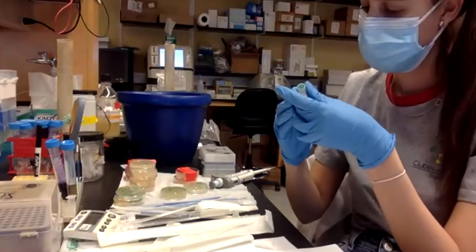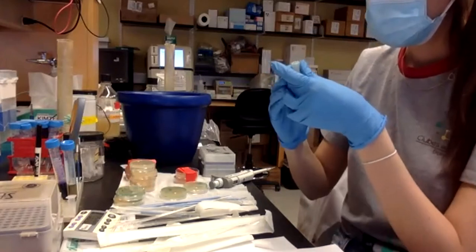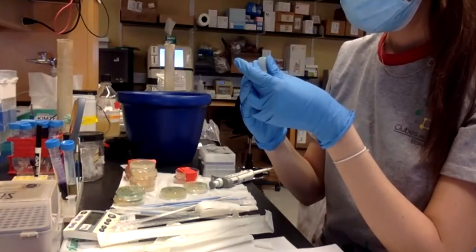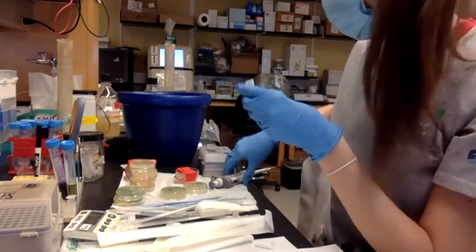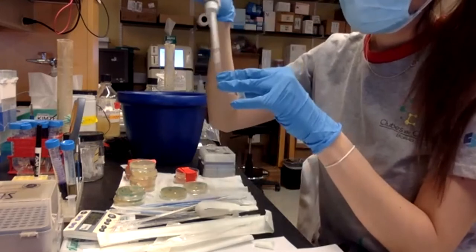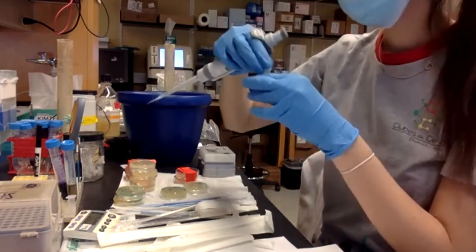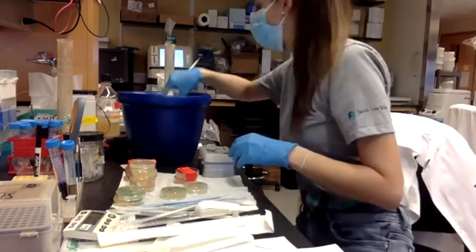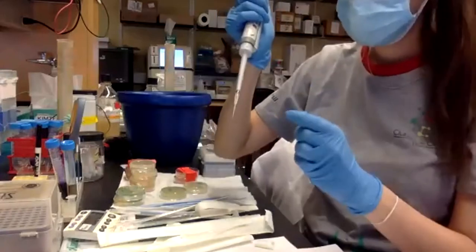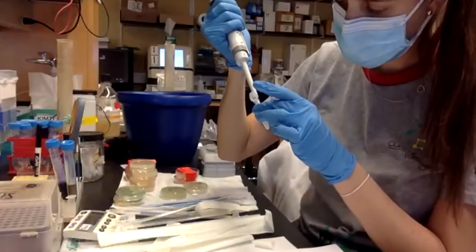Okay. We add it to D. We leave it for 10 minutes. And I think we are almost done.